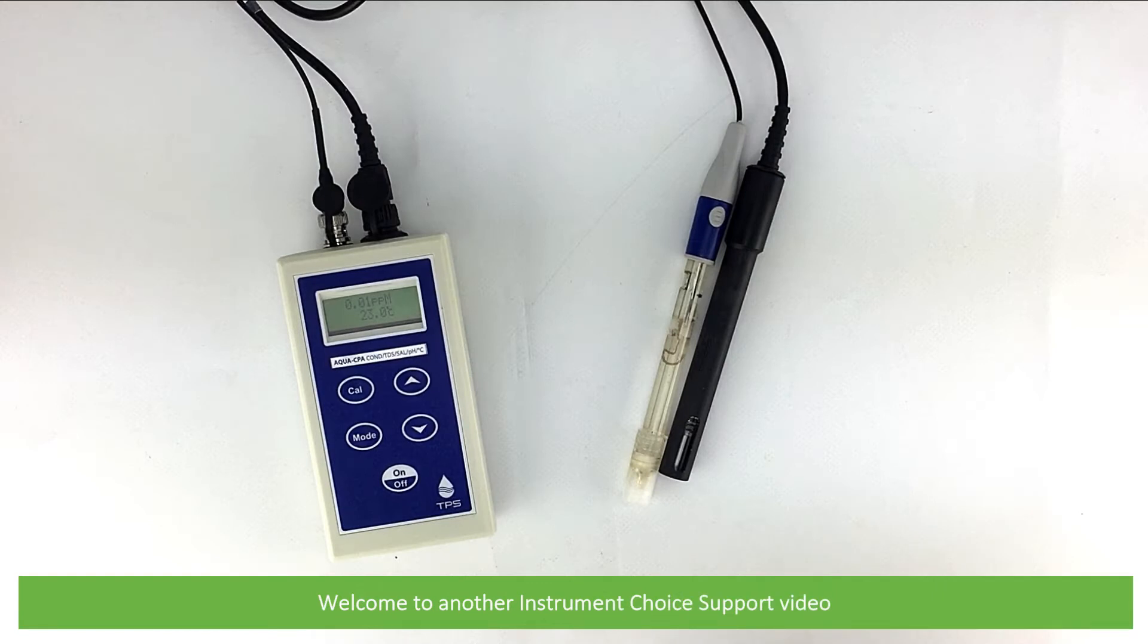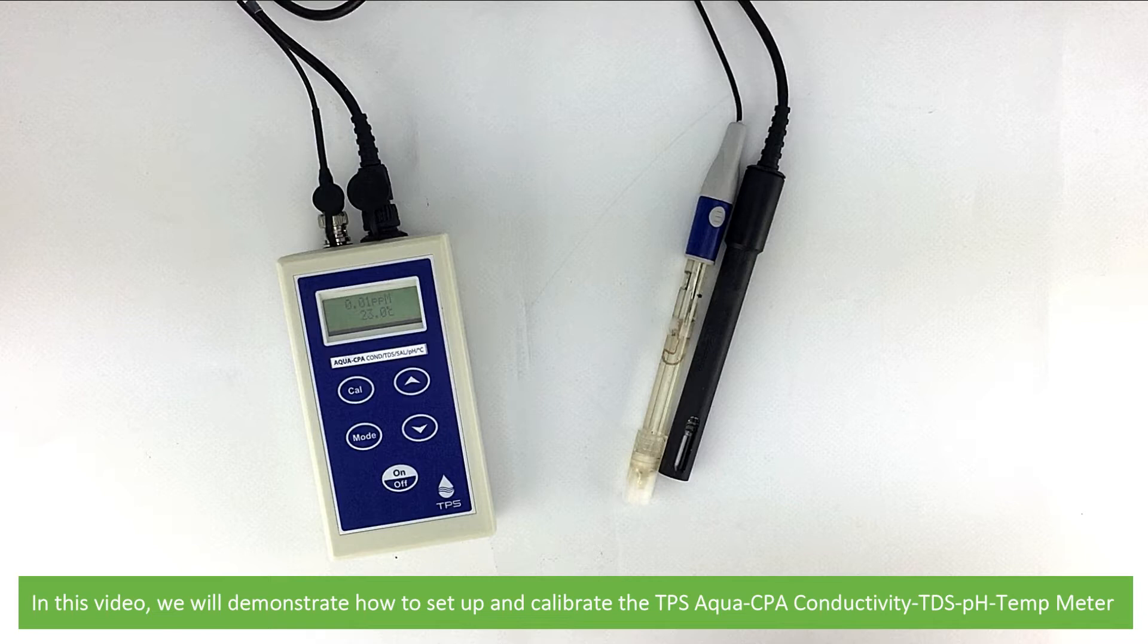Hi and welcome to another Instrument Choice support video. In this video we'll demonstrate how to set up and calibrate the TPS Aqua CPA conductivity, TDS, pH and temperature meter.